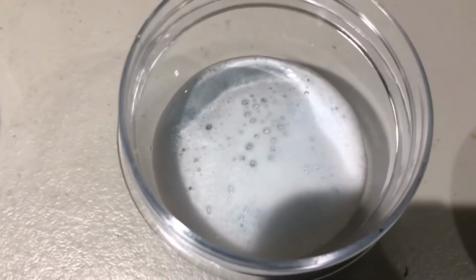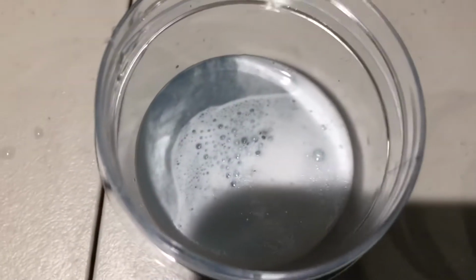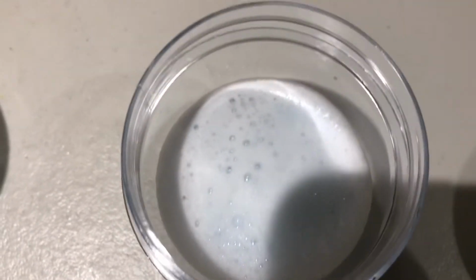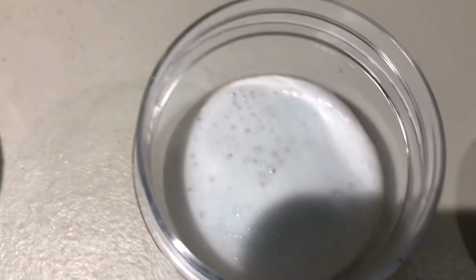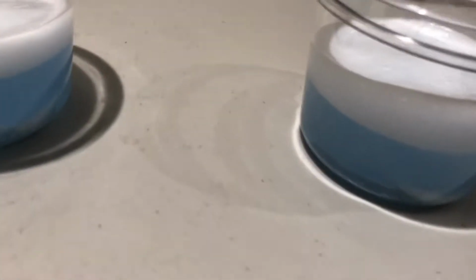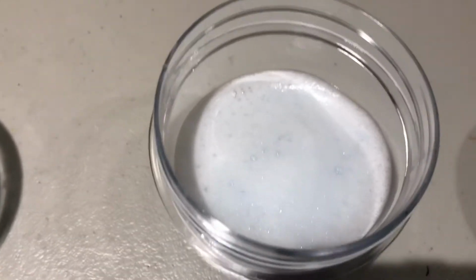Now, the higher concentration, if you notice, is a bit more, okay, in terms of the amount of bubbles produced. Not much more, okay, but you notice that the circumference is all filled already, right? Rather than this one, okay? So this particular experiment is not as conclusive as the temperature, but the higher concentration did produce more bubbles more rapidly, okay, but it wasn't that much faster. Maybe I should have made a much higher difference in dilution, but it still proves the point.